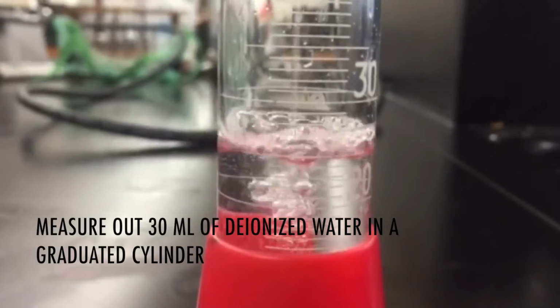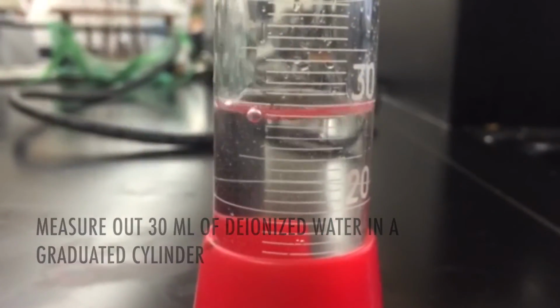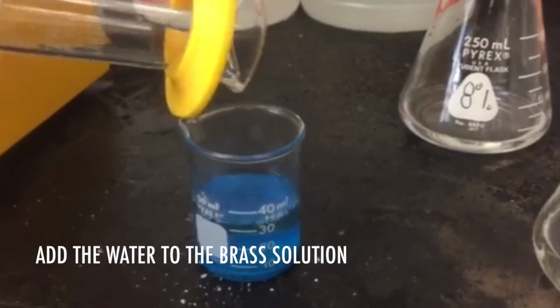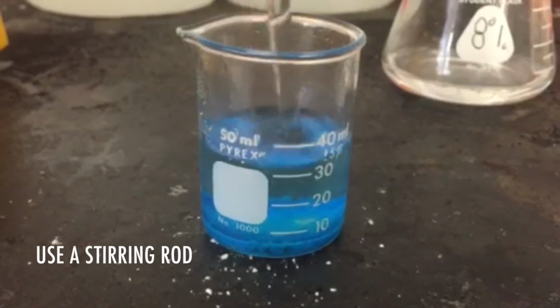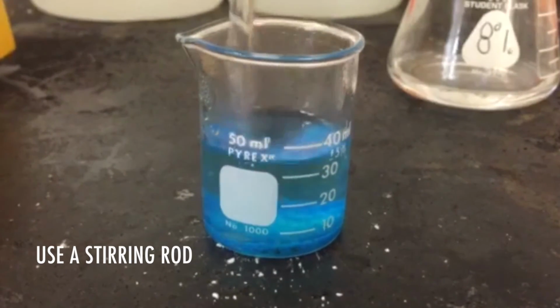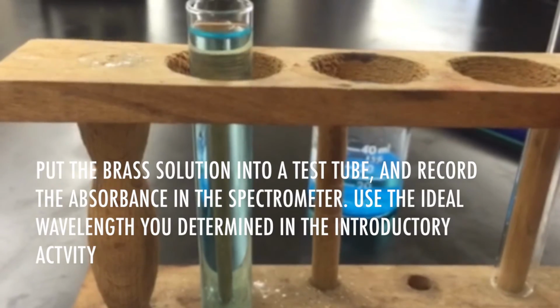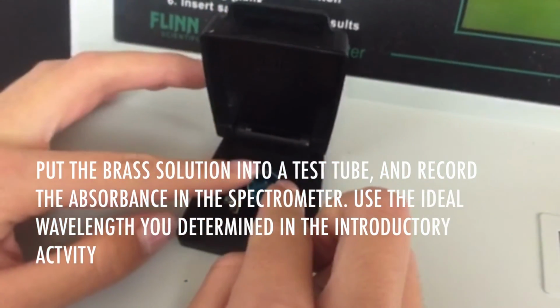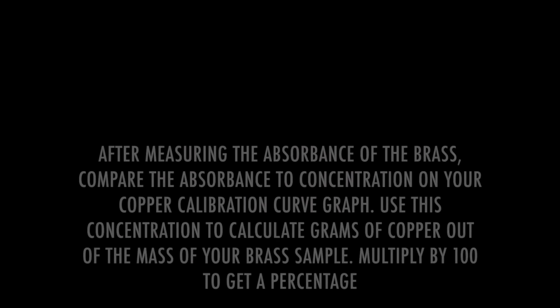Measure out 30 milliliters of deionized water in a graduated cylinder. Add the water to the brass solution. Use a stirring rod. Put the brass solution into a test tube and record the absorbance in the spectrometer. Use the ideal wavelength you determined.